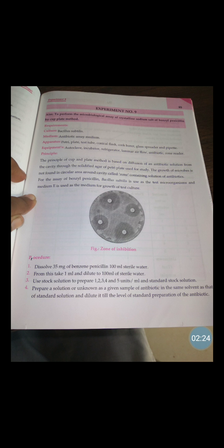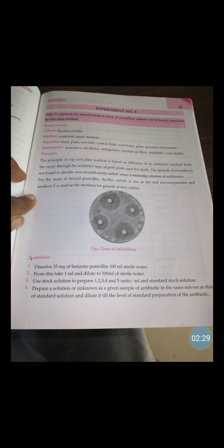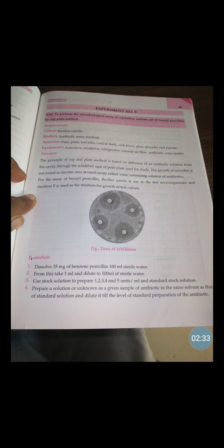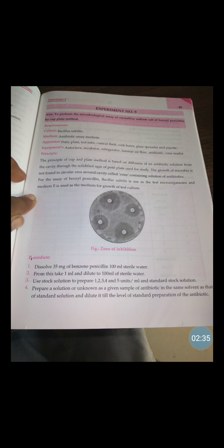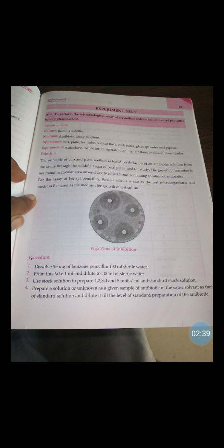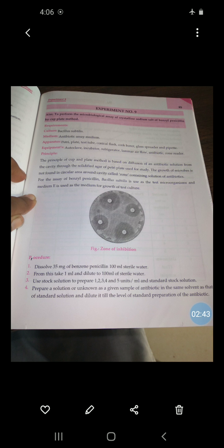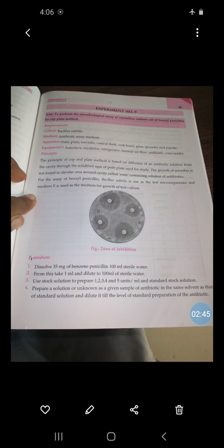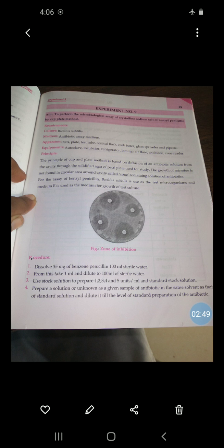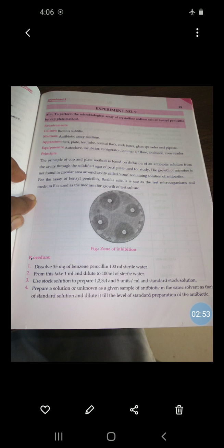For the assay of benzyl penicillin, Bacillus subtilis is used as the test microorganism, and medium E is used for the growth of the pre-test culture. Now for the procedure: first, dissolve 35 milligrams of benzyl penicillin in 100 ml of sterile water.